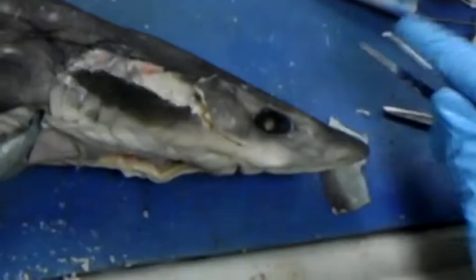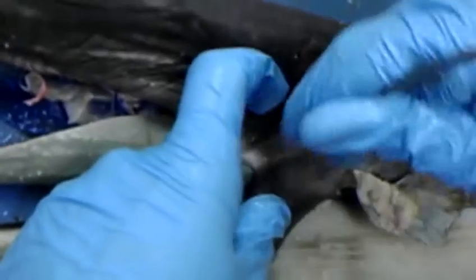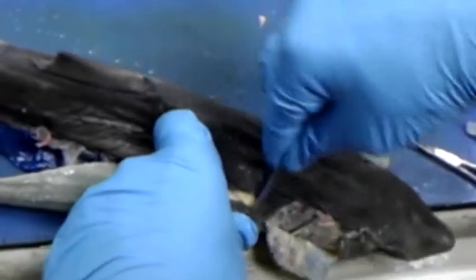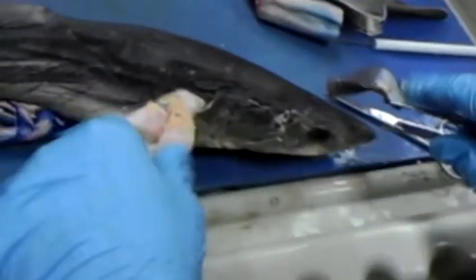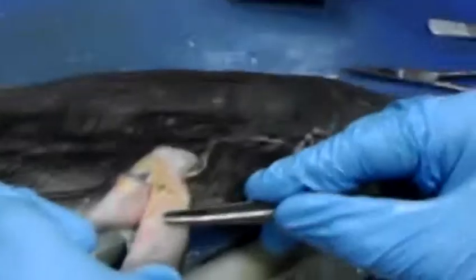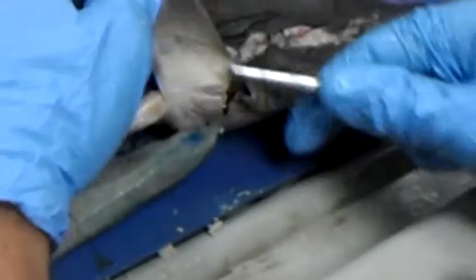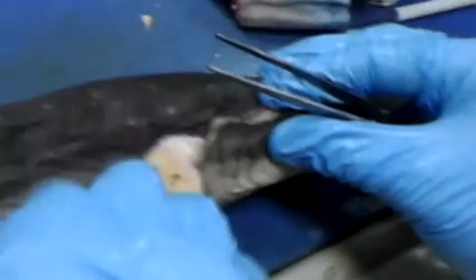The other muscles that we have listed are the levators and depressors. These are the ones that insert on the pectoral fins. So see these muscles in here? These are the levators, because when they work, what is it doing? Raising. And just trust me, same looking structures here, but they're called depressors. When they work, they lower it. Well, that's about all the movement a shark has. They can do this, they can do this.